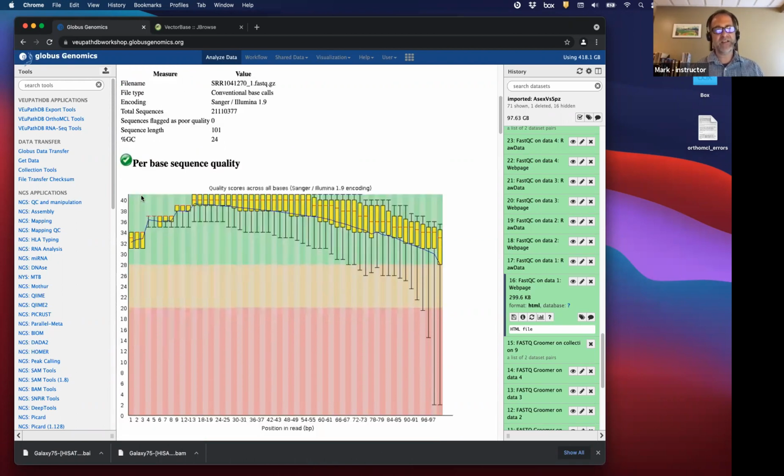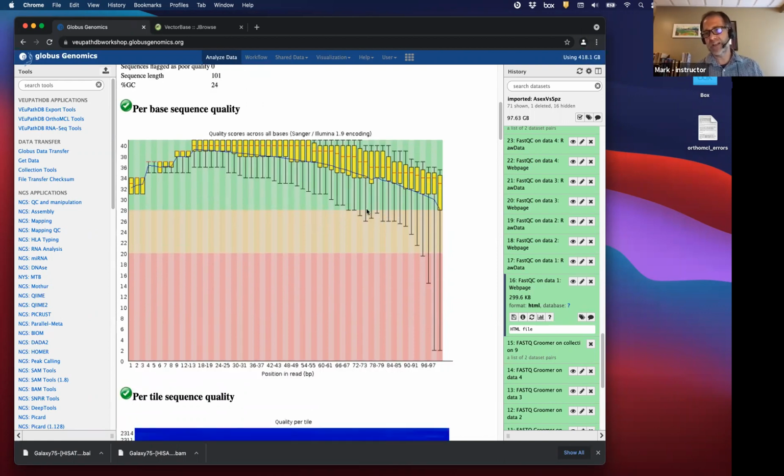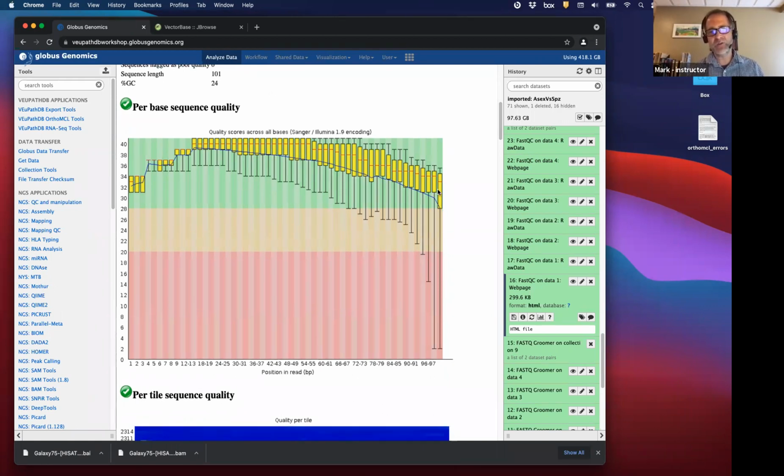And then the next thing we look at is the per base sequence quality. These are all the positions across each read, and on average, what is the score? Any score above 20, which is in negative log, is a really good score. It's a really low probability that the base was called incorrectly. And you can see it's really high. It's in the green section, which is very good. And then it decreases at the end of the read, and that's usually what happens. The longer the read you have, the lower quality you get at the end of the read. But even at the end of the read, I would say the quality is very good.